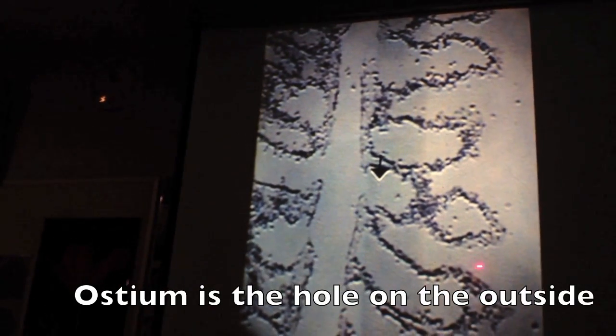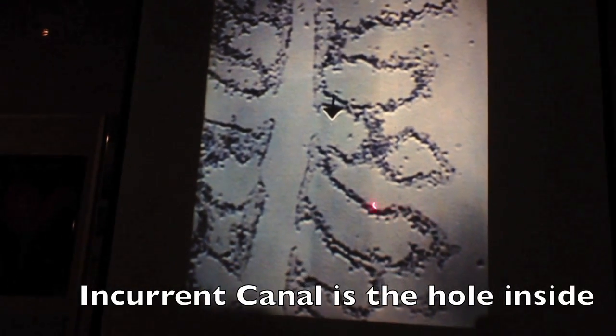No, the ostium is the hole. The incurrent canal is the place just on the other side of it. So you go through the ostium to the incurrent canal. And these ones that enter the spongocoel, those are the radial canals. And the prosopyles are going to be right in here.